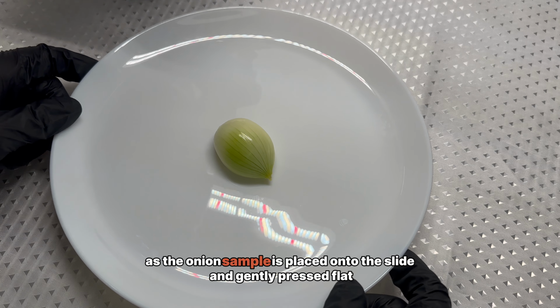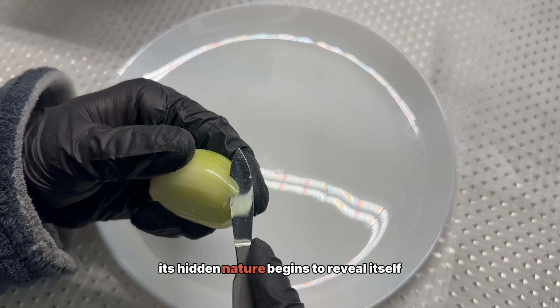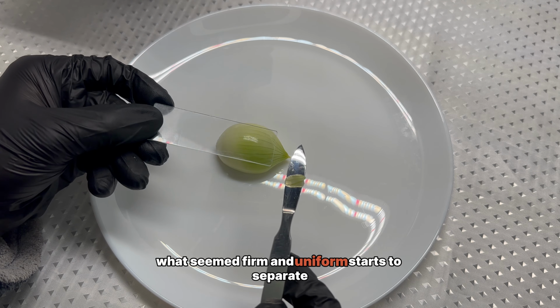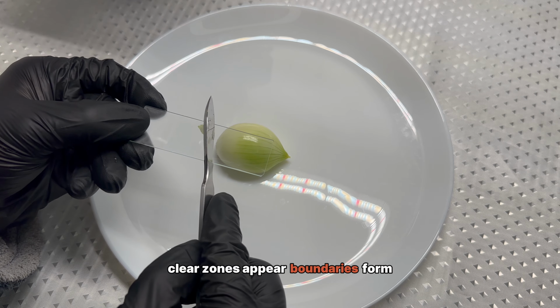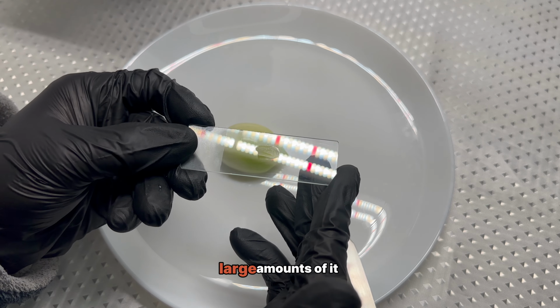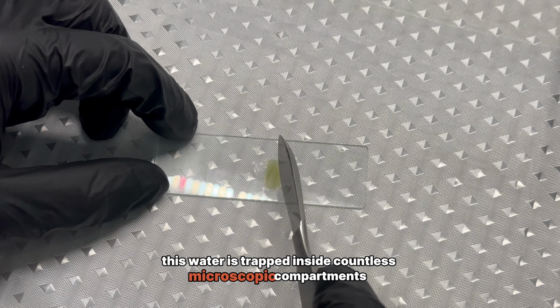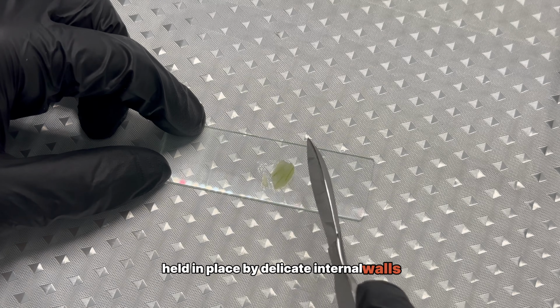As the onion sample is placed onto the slide and gently pressed flat, its hidden nature begins to reveal itself. What seemed firm and uniform starts to separate. Clear zones appear, boundaries form. An onion is built around water, large amounts of it. This water is trapped inside countless microscopic compartments, held in place by delicate internal walls.